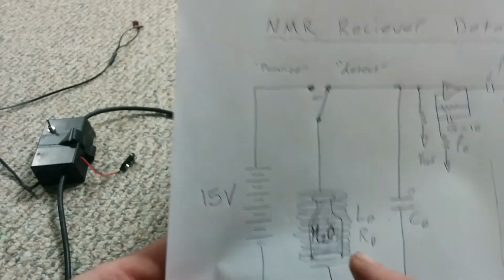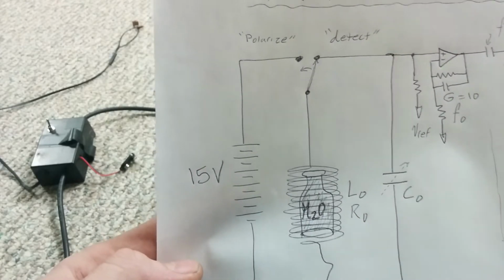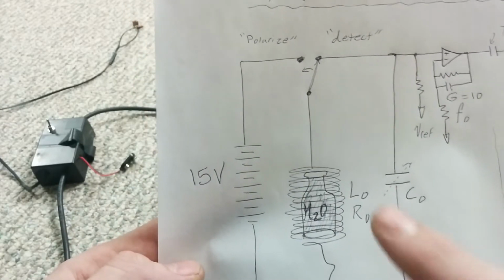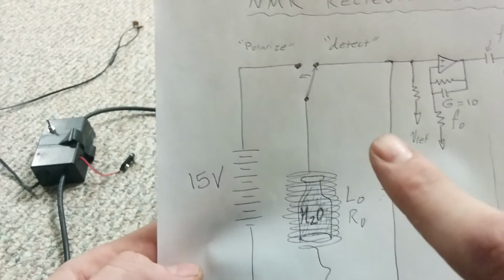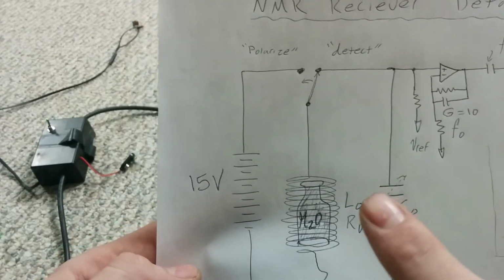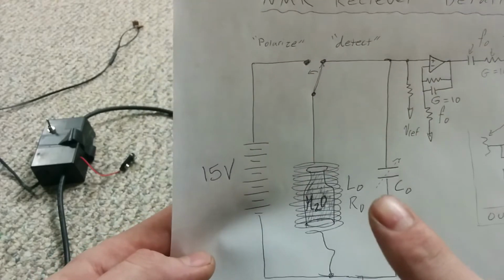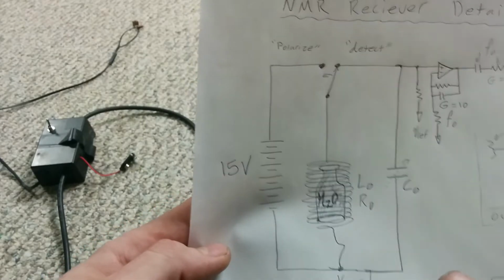Okay, and so the coil has its own natural ring down, right? It's been carrying a bunch of current, and you're suddenly interrupting that current, and there's stray capacitances, and it's an inductor, and its own distributed elements are going to have to discharge their energy. And so it's really important that you have not just the big tuning capacitor to absorb that jolt, but also you need, and I don't have them drawn here, some suppressor diodes and stuff, and a DC path to ground, because you want this cap to start off with zero charge when you slam the coil across it.